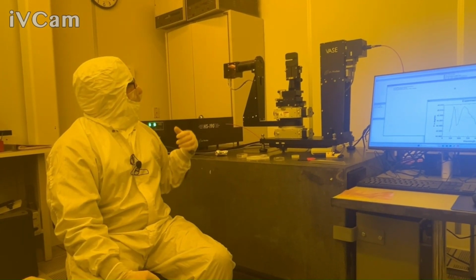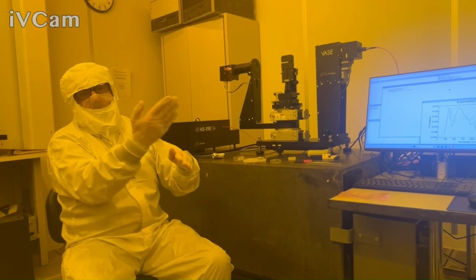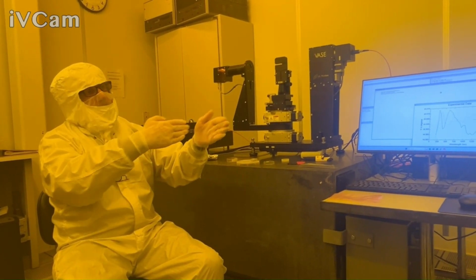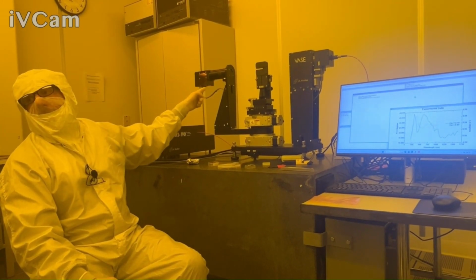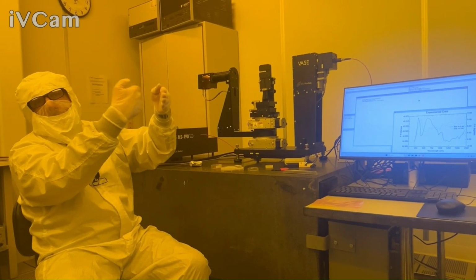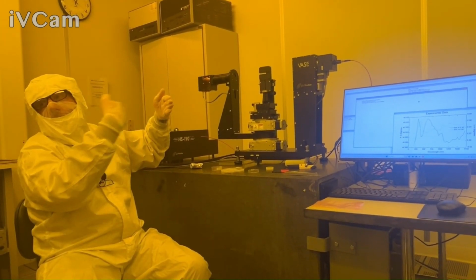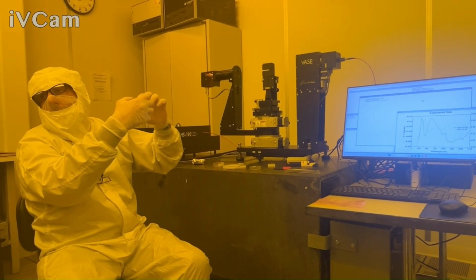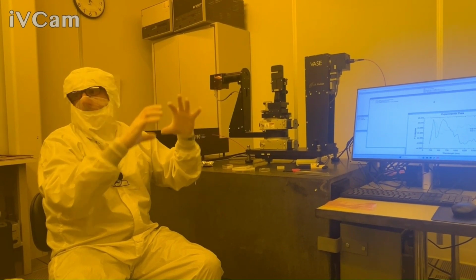Similarly here, this is a very nice base, and it's easier to do vertical versus horizontal because you don't have to worry about gravity. But if I baseline in the air condition like I'm in right now, and then I put a sample on there and it's not perfectly aligned, and I go to reflection, well, the beam for the air measurement versus reflection might have been a little bit off. So a lot of times it'll be a relative error. Everything will be shifted a little bit.